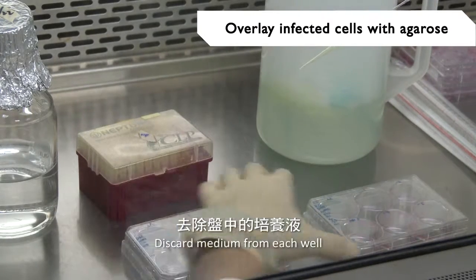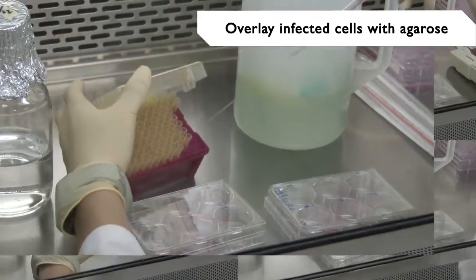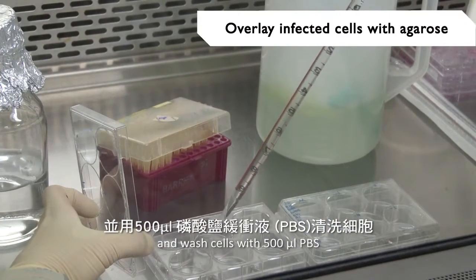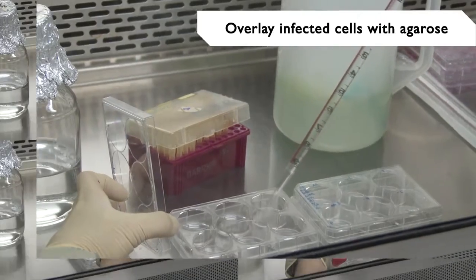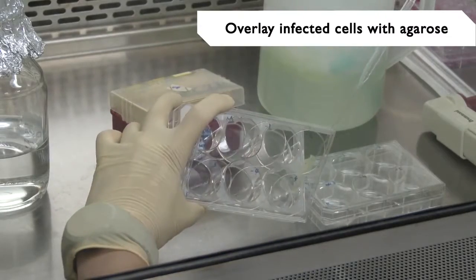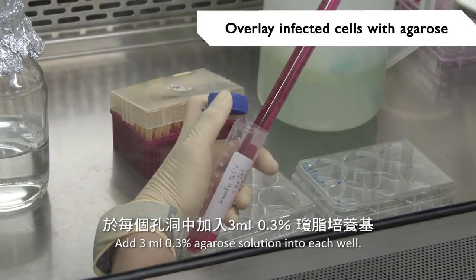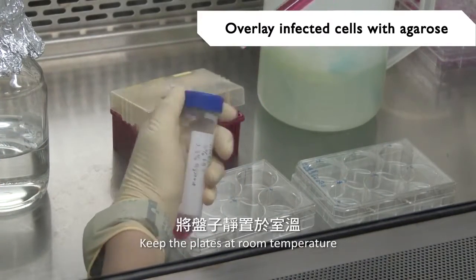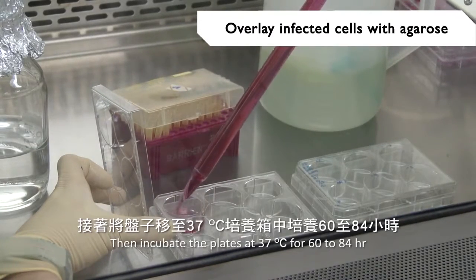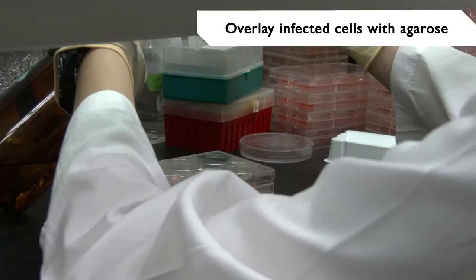Discard the medium from each well and wash the cells with 500 microliters of PBS. Add 3 ml of 0.3% agarose solution into each well. Keep the plates at room temperature until the agarose overlay solidifies. Then incubate the plates at 37 degrees Celsius for 60 to 84 hours.